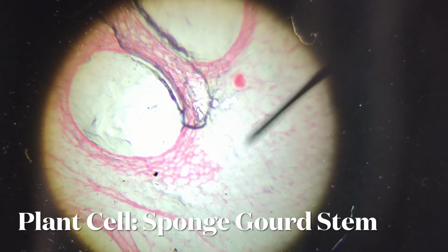For those of you who have already learned about the plant transport system, that means the water carrying tubes and the food carrying tubes, you can see that the big circles here in the cell structures are those of the plant transport tubes. Those are the plant transport tubes because it's a cross section of the stem of the sponge gourd. You can see that it's a plant cell because all the cells have a regular shape that enables them to interlock with each other to form a structure that gives rise to the water carrying tubes and the food carrying tubes.